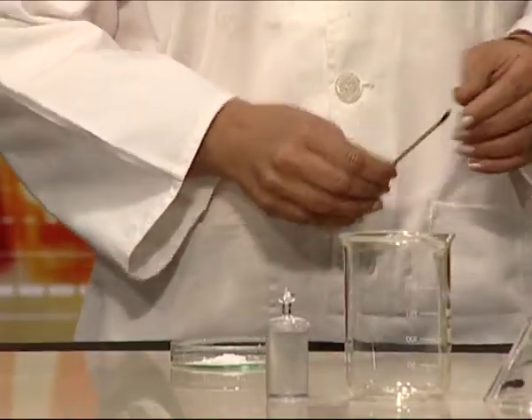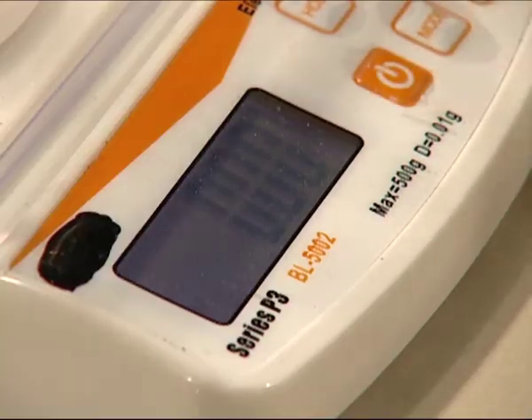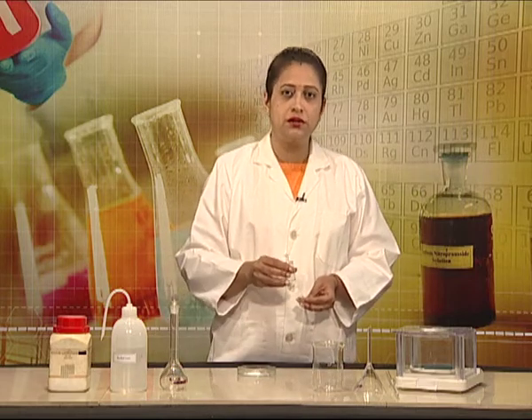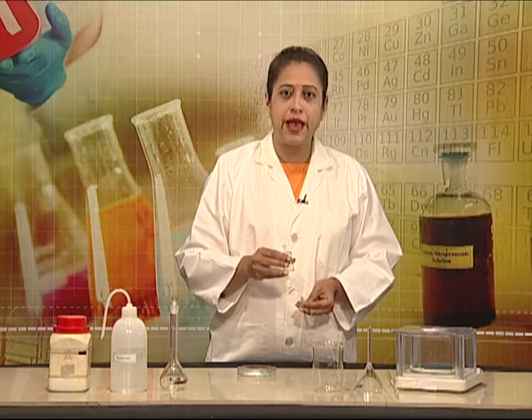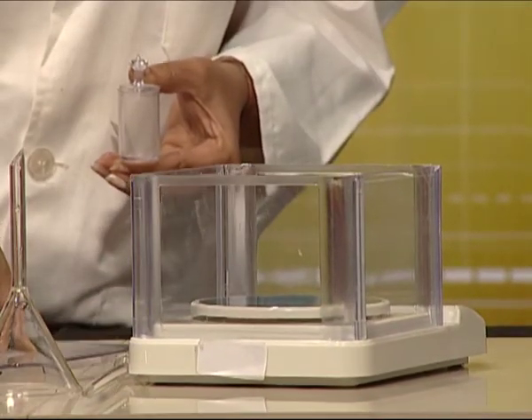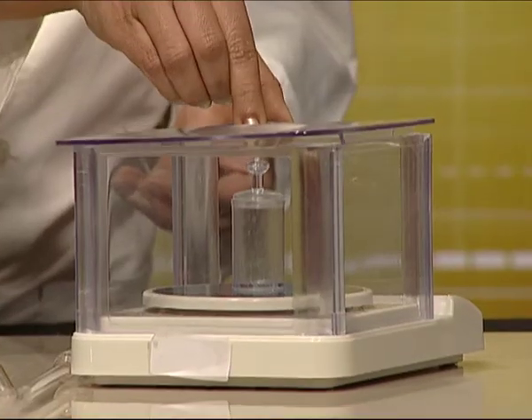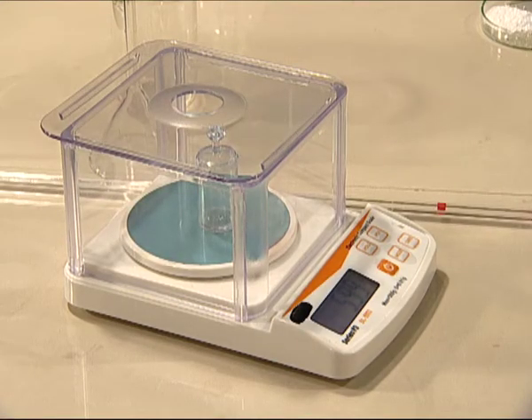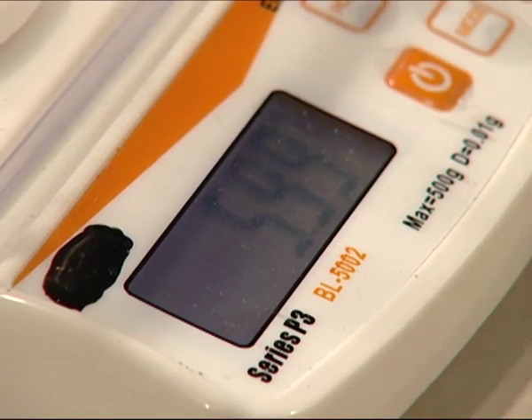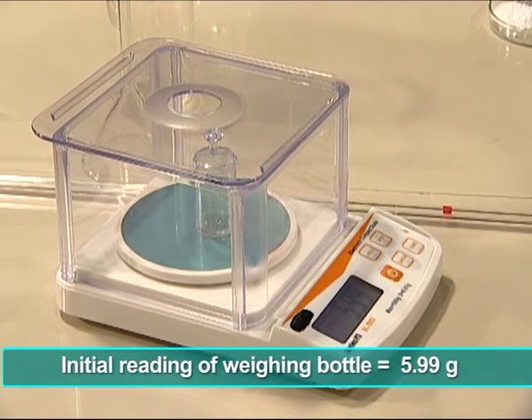Now we will first take the digital balance initial reading. It works out to be 0, which means our balance is ready for use. We place the weighing bottle on the digital balance — or in its absence we may use a watch glass. We place it safely, put the cover on, and wait for the reading to settle. It works out to be 5.99 grams, so the initial reading of our weighing bottle is 5.99 grams.